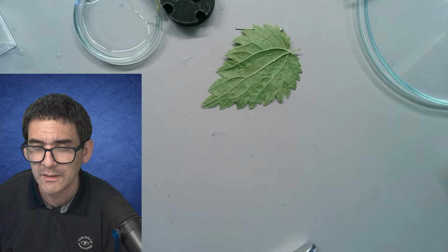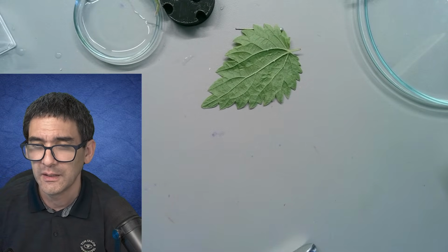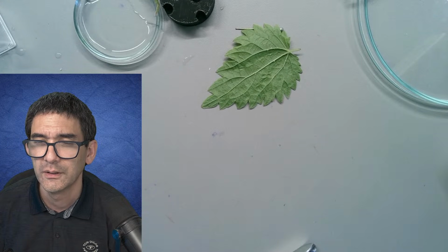Yeah, histamine. Yeah, formic acid. Yes, yes. Yeah, histamine that causes this immune reaction.